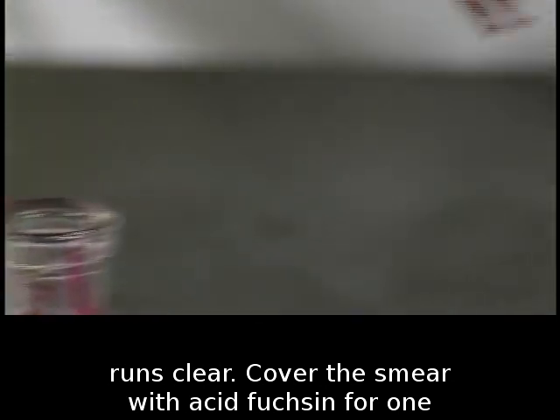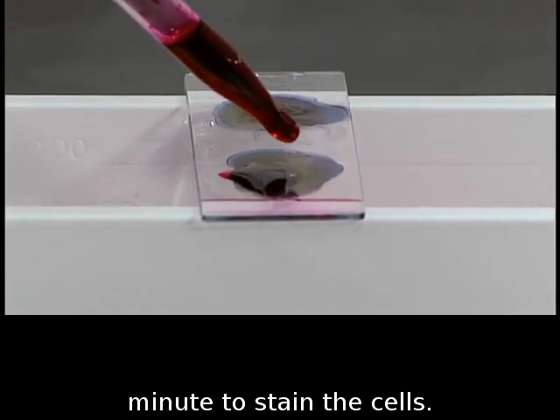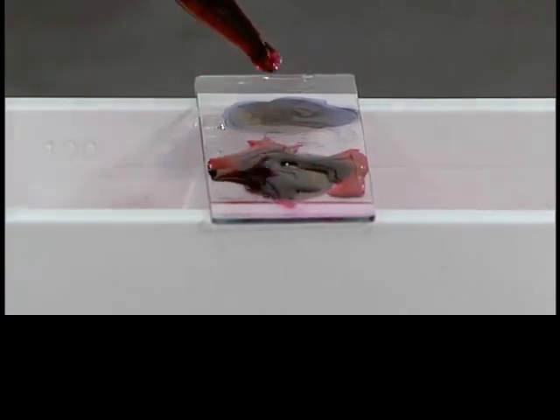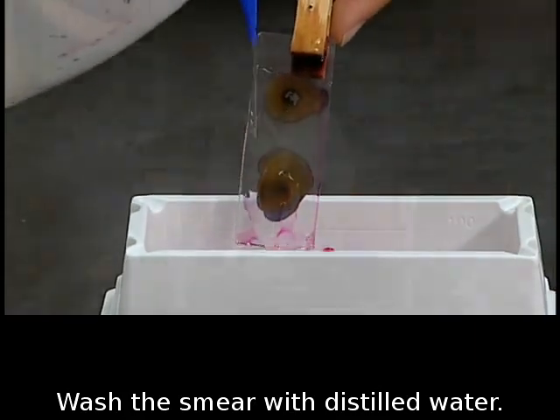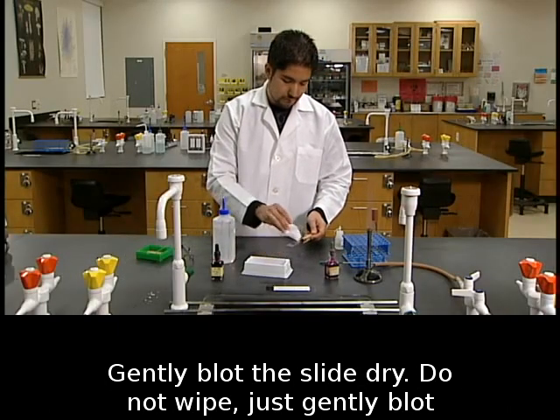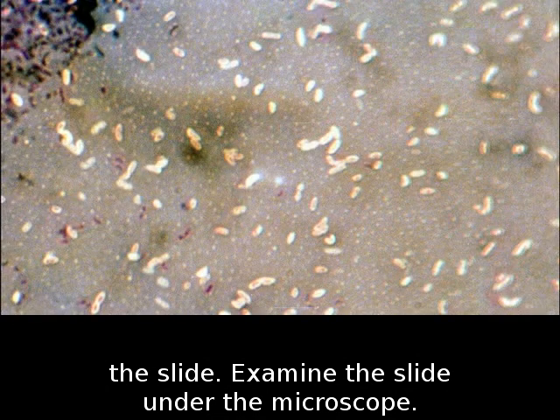Cover the smear with acid fuchsin for 1 minute to stain the cells. Wash the smear with distilled water. Gently blot the slide dry. Do not wipe, just gently blot the slide. Examine the slide under the microscope.